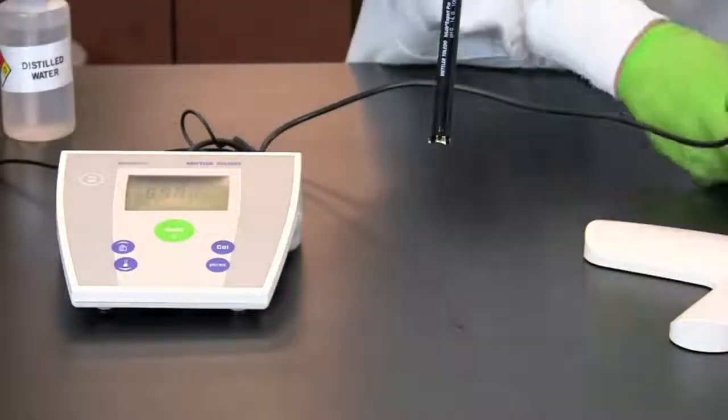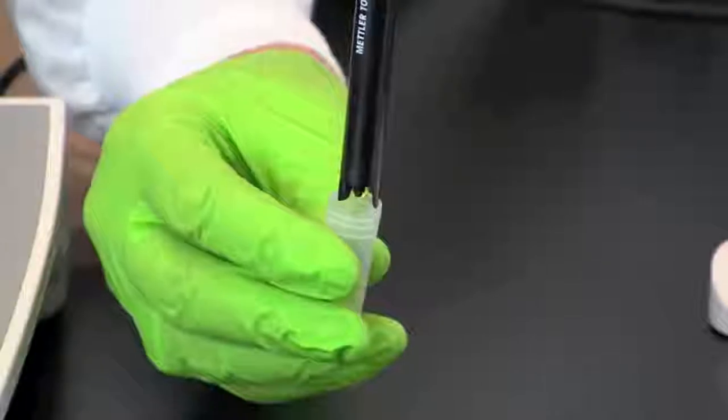If this is your final sample, replace the protective electrode cap for storage.